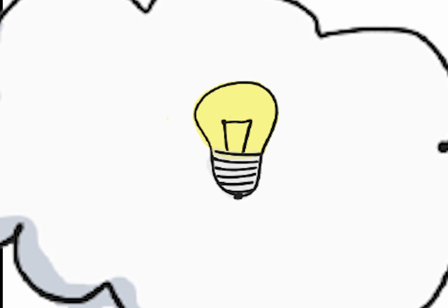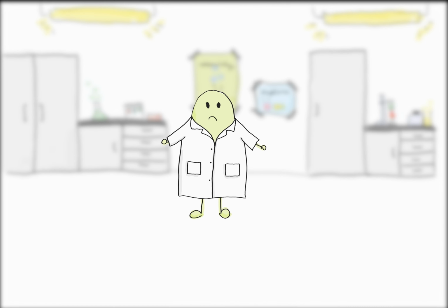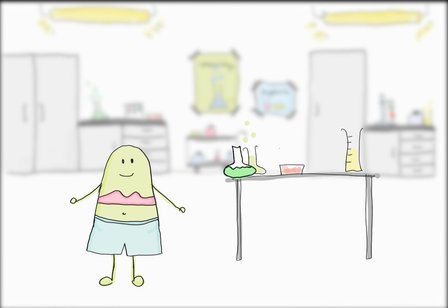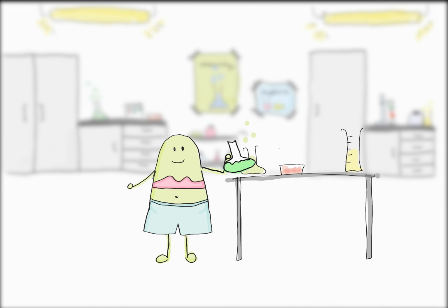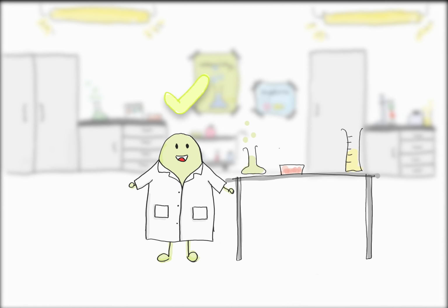Well, let's see. Wearing a laboratory coat during the experiments is obligatory. Oh no, laboratory coats. One of my classmates who loves to look stylish could refuse to put on a lab coat. If she would accidentally pour some acid onto herself, this would lead to severe chemical burns, which is definitely not funny. Maybe this rule makes sense after all.